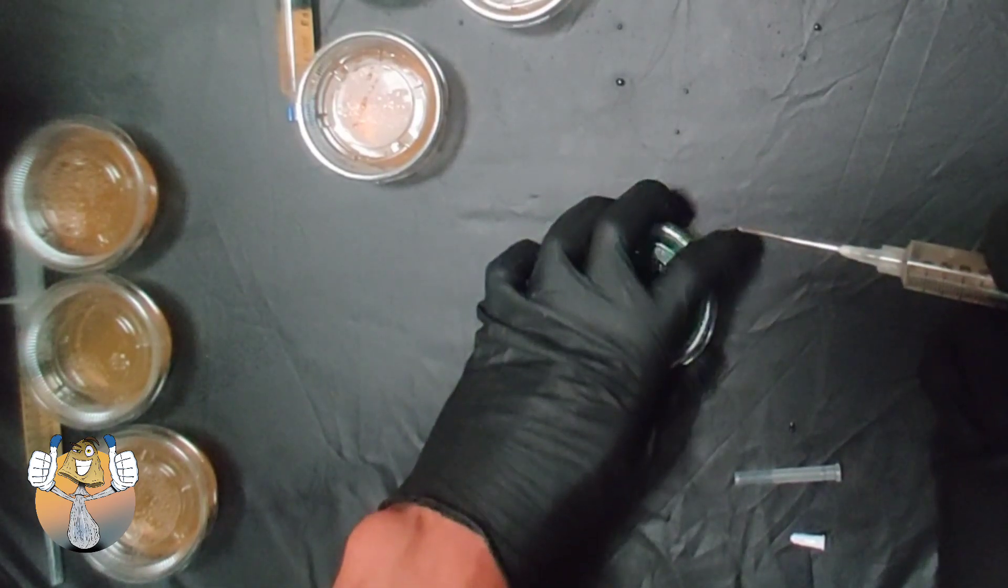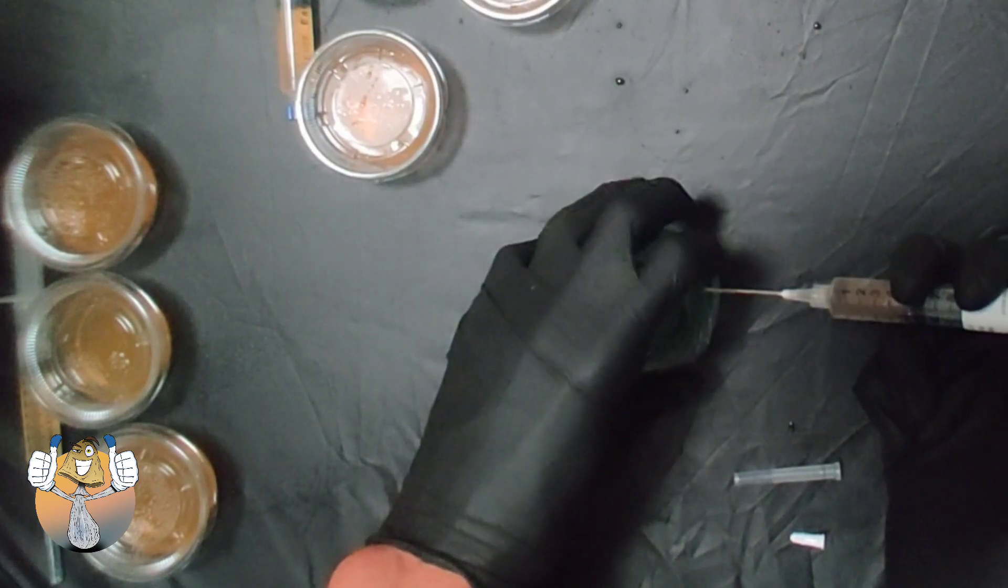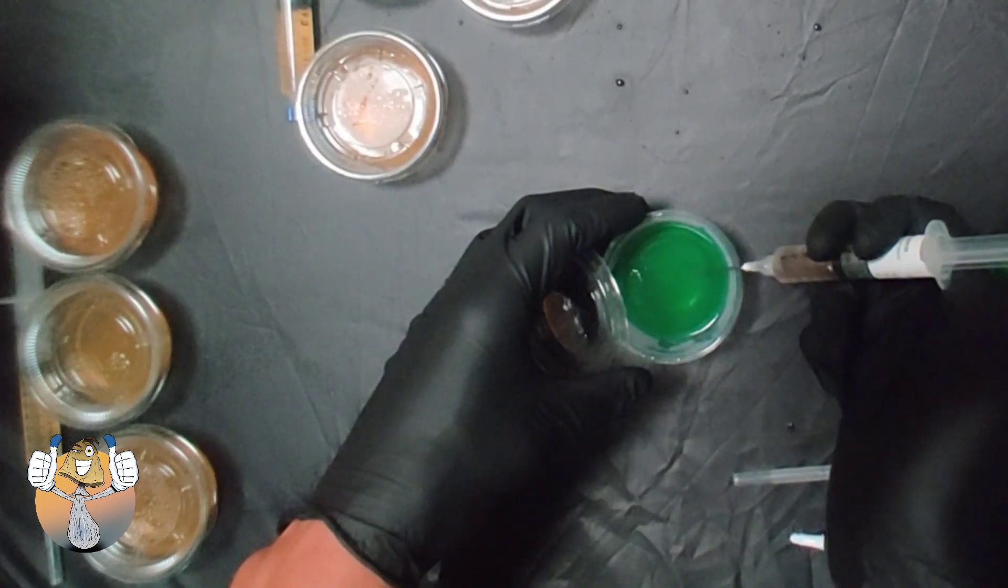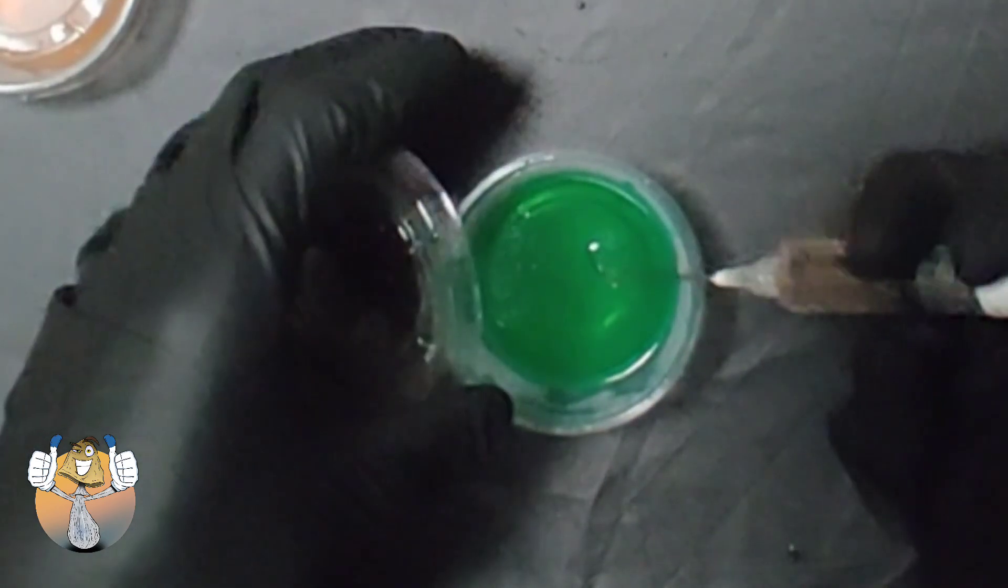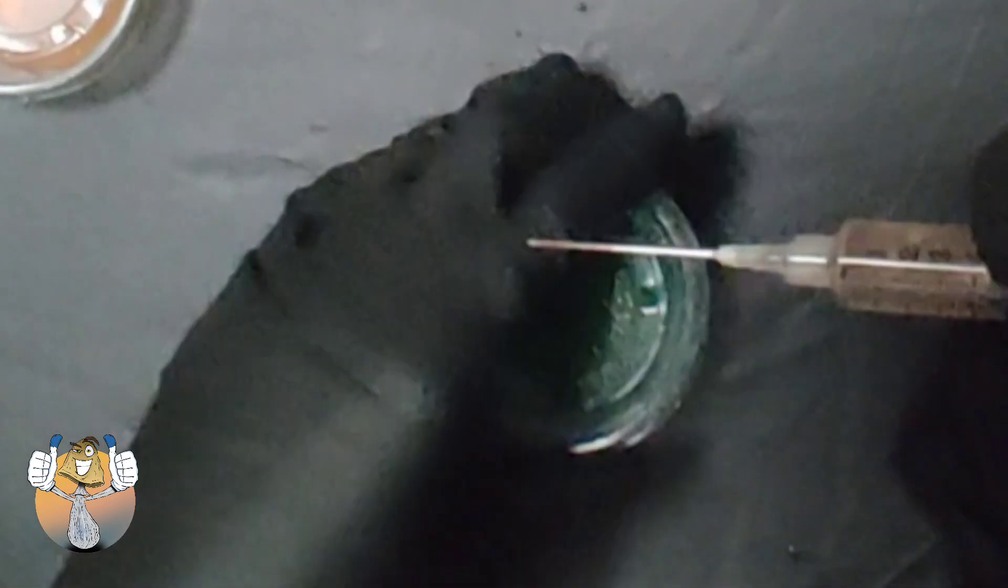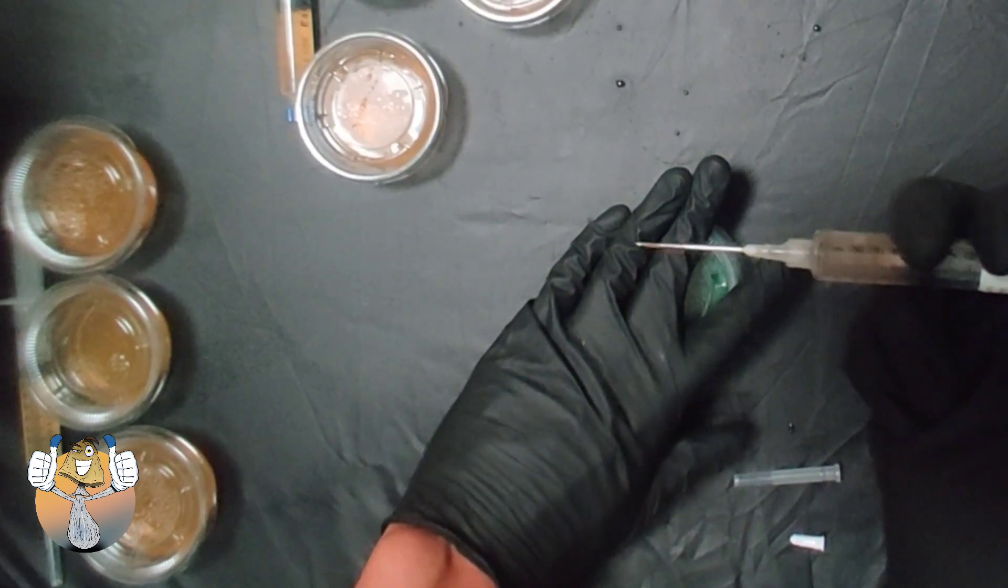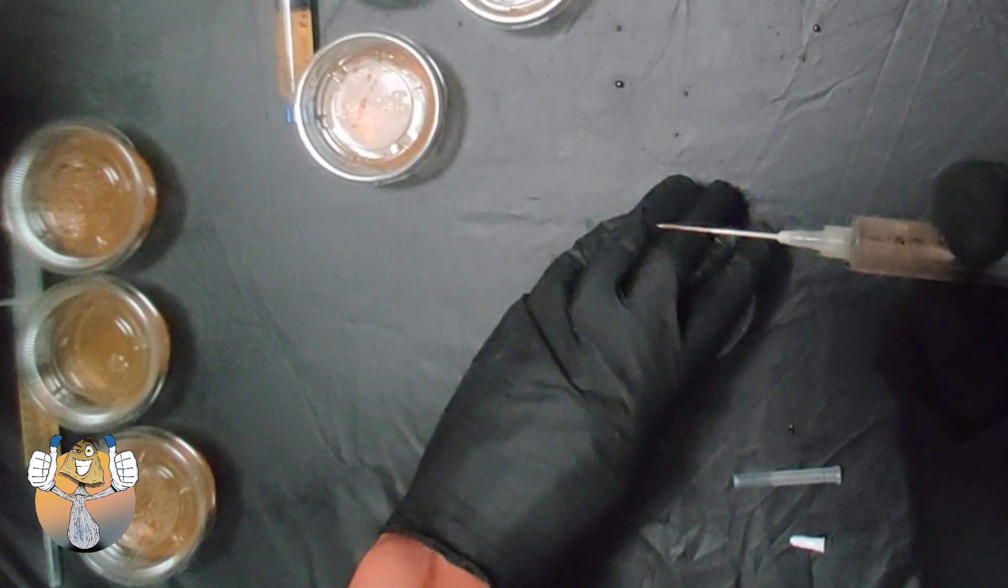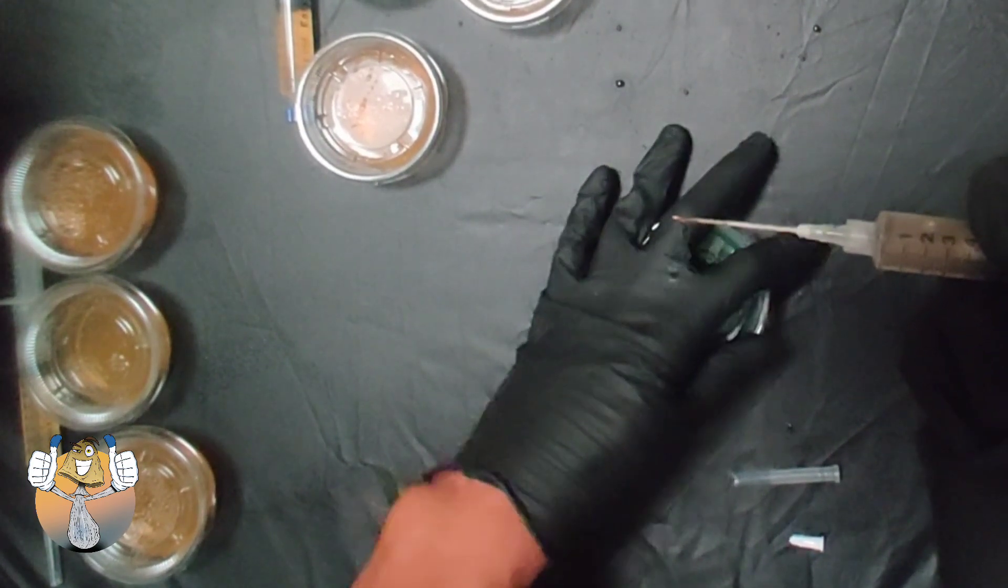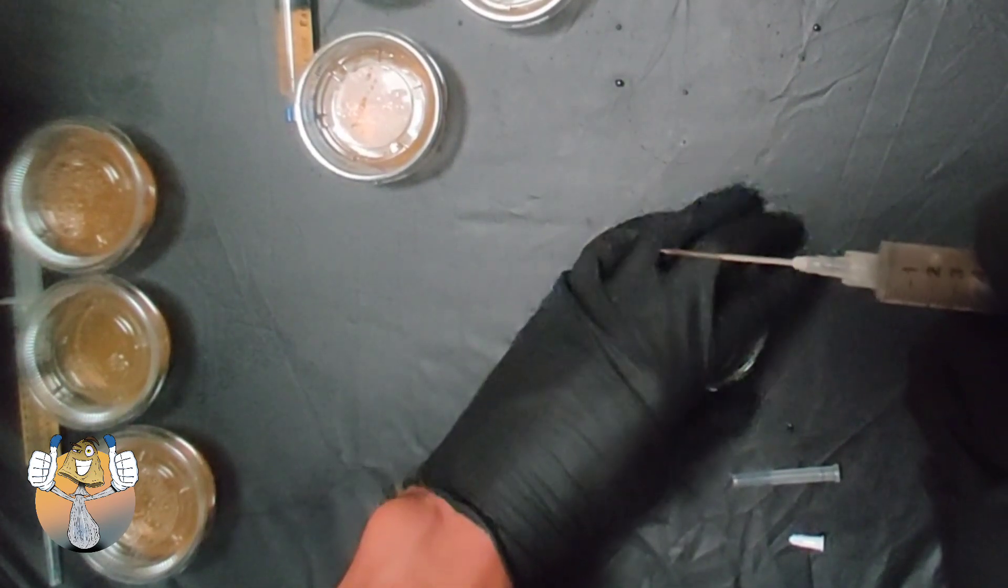So this last agar plate lid gave me some issues closing. You can see here we got some right there in the middle, nice little amount, but for some reason the lid like folded under itself. And I'll show you in the update video exactly what I mean. Let's get it, let's go.